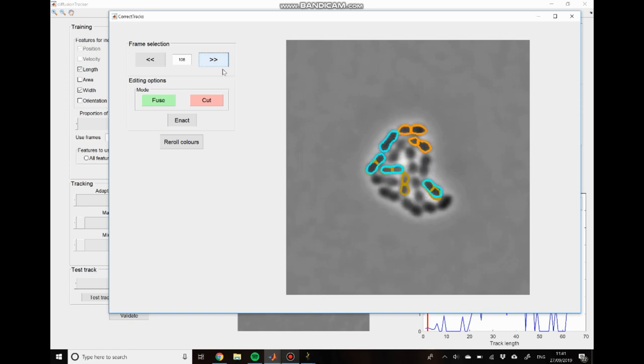But in this case, at time point 106, you can see that we have these two cells appearing without any corresponding cyan outline. We go through, so this is where the two cell tracks are beginning. And then we go through to 108, and that's where you see the cyan outline appearing. And this is basically a case where you have segmentation of the two daughter cells at this time point, but then they re-fuse in the segmentation algorithm to generate the original cell again. So this trajectory, kind of the mother trajectory, overlaps to a certain extent with that of the daughters.